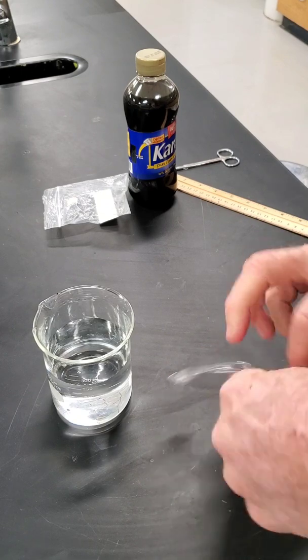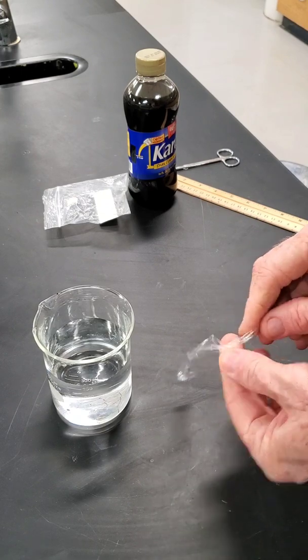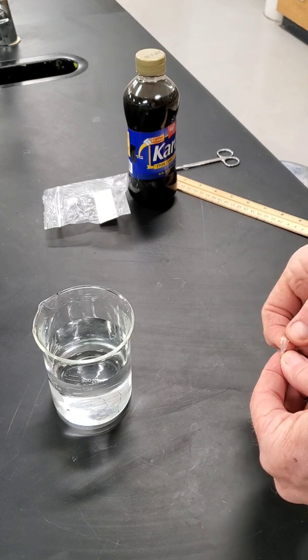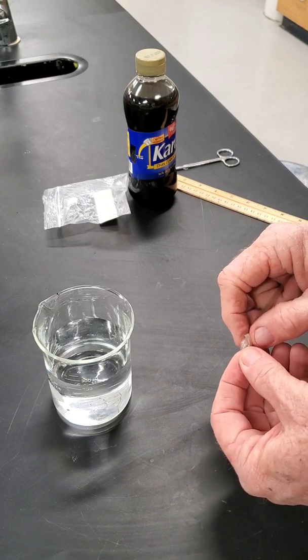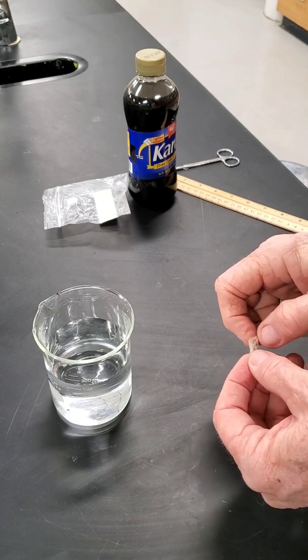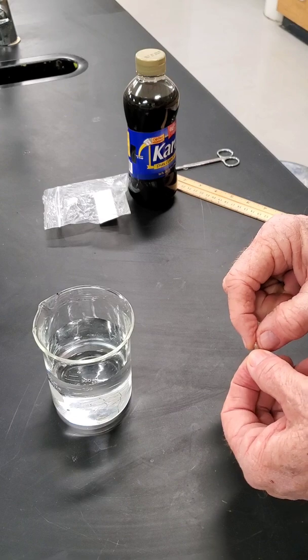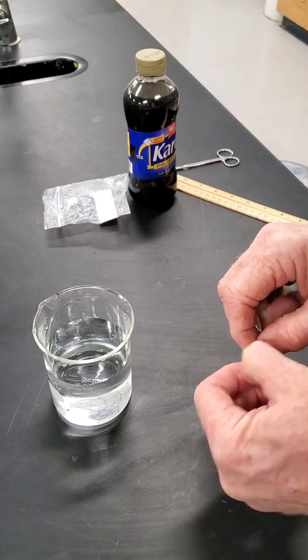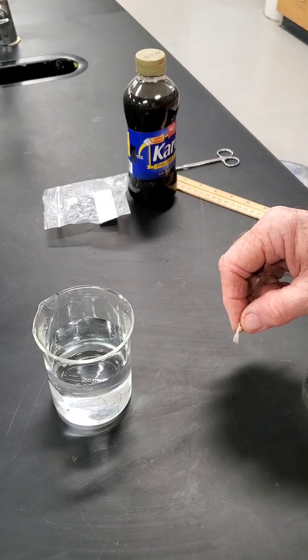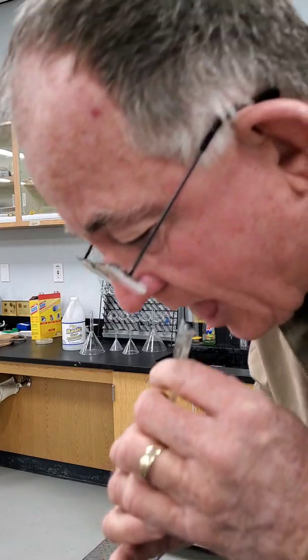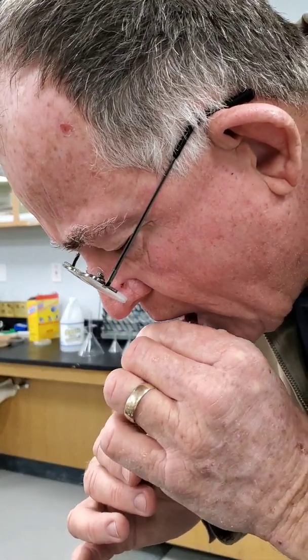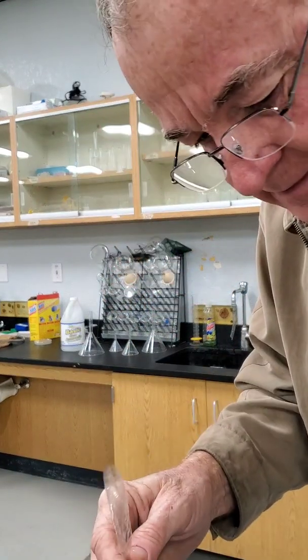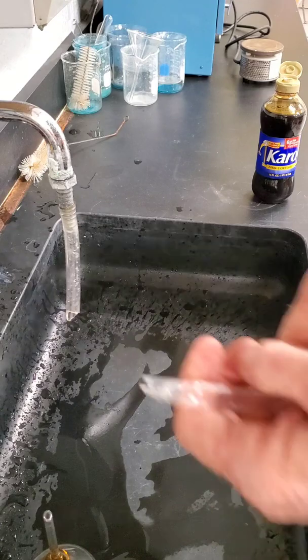We're going to take one end of our tube and we're going to tie it in a knot as close to the end as we can get it. We're going to slide our knot down as close to the end of our tube as we can get it and pull that tight. The other end of our tube, we'll just blow into it and it opens up.